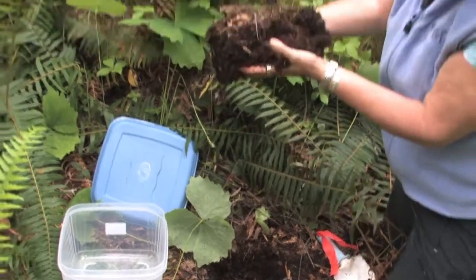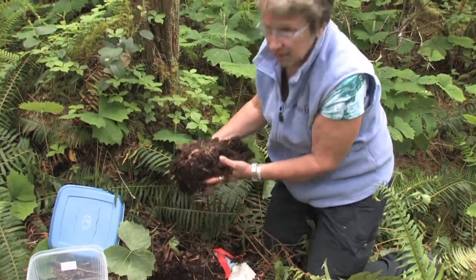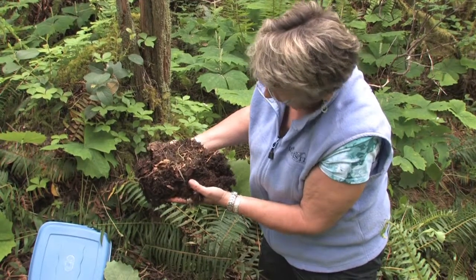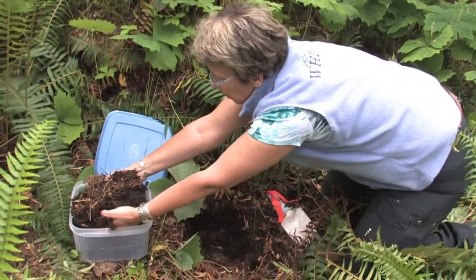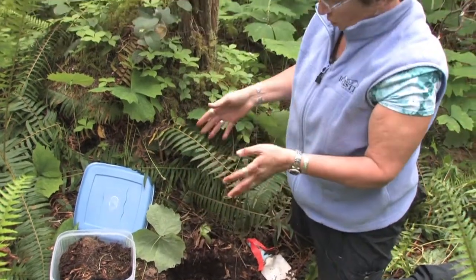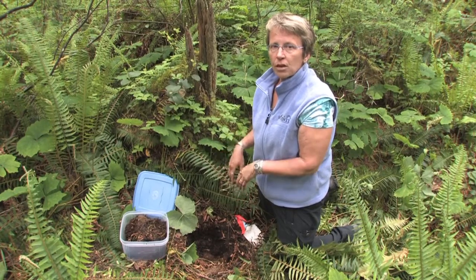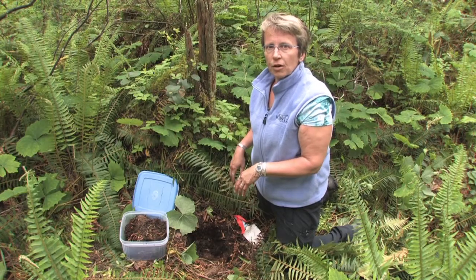We now have our soil block, and you can see there's mineral soil present. We've got the whole of the organic layer and we'll take this back to the lab for hand sorting. Because we know the area of soil we took, we can do a bulk density calculation and work out the numbers of these animals per square meter of soil.